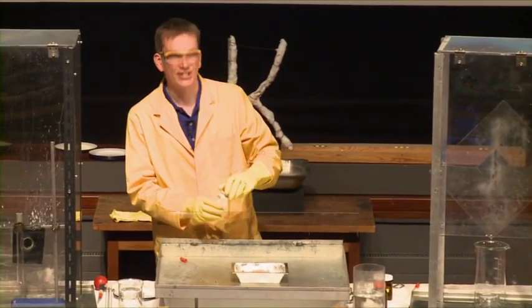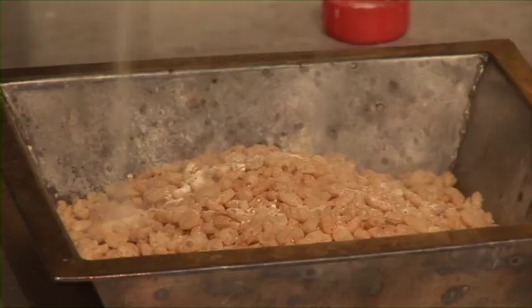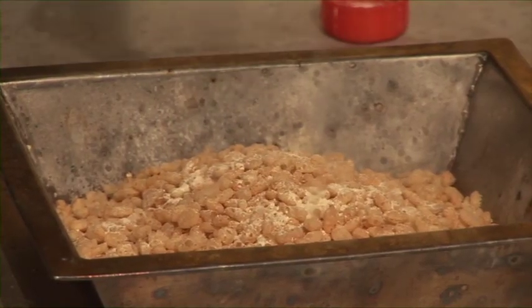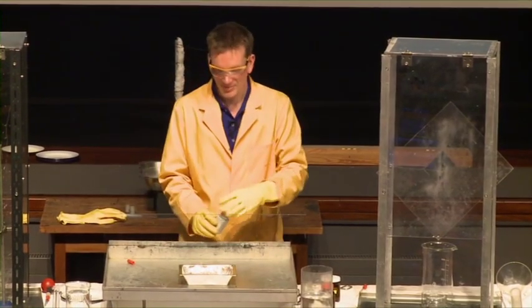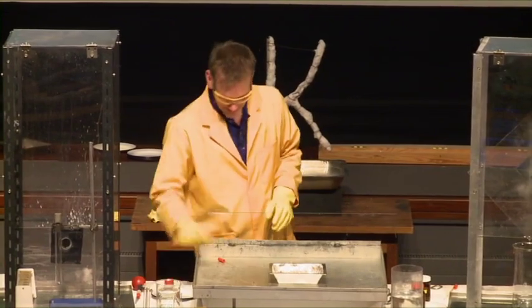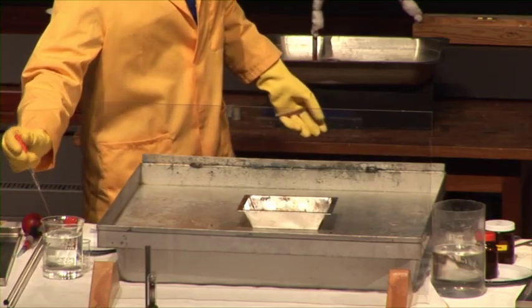The oxygen here is in the form of sodium peroxide — a nice yellow powder. I'm going to sprinkle this on just like I would sprinkle sugar on. Maybe that was a little bit too much sugar. And then, well, you'd add your milk — I'm not going to add milk, I'm going to add some water.